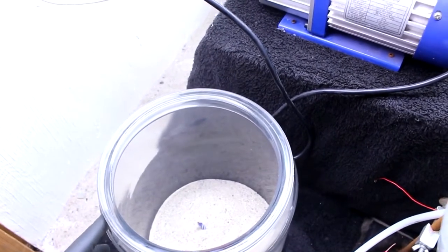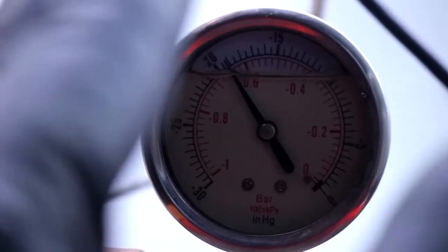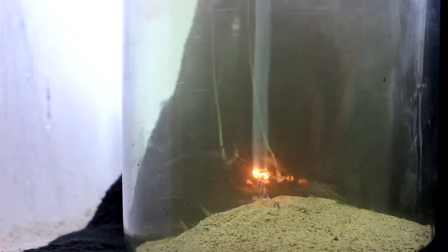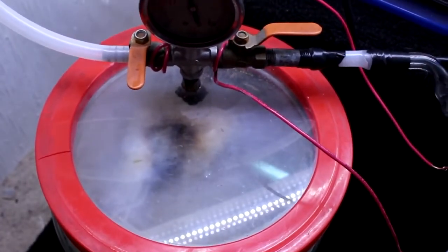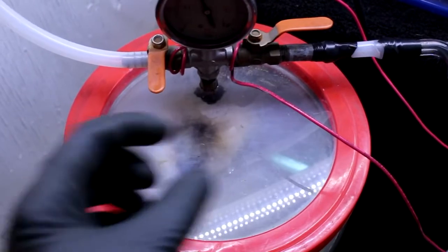We're now at just over a third of an atmosphere worth of chlorine. Let's light this candle. It's burning — and it went out. See the soot? It definitely had some combustion of the wax, but the flame was not able to sustain itself. It seemed to go out as soon as the heat from the wire stopped supplying energy. So we're going to try again with more chlorine — more pressure, maybe twice as much as that.